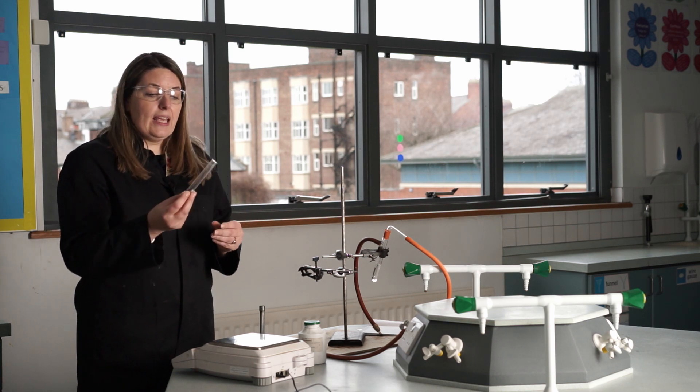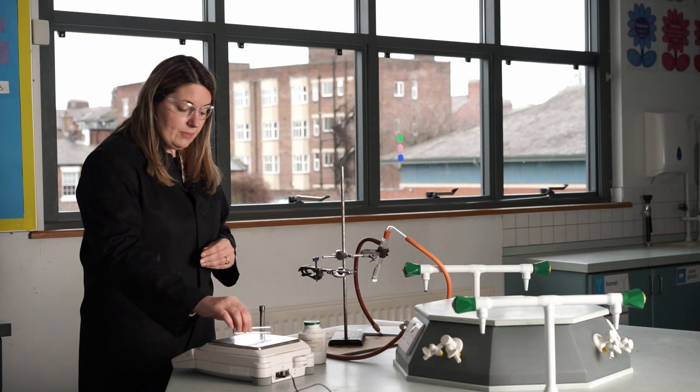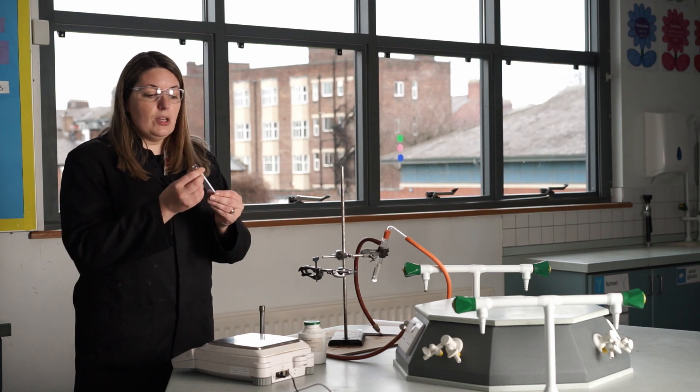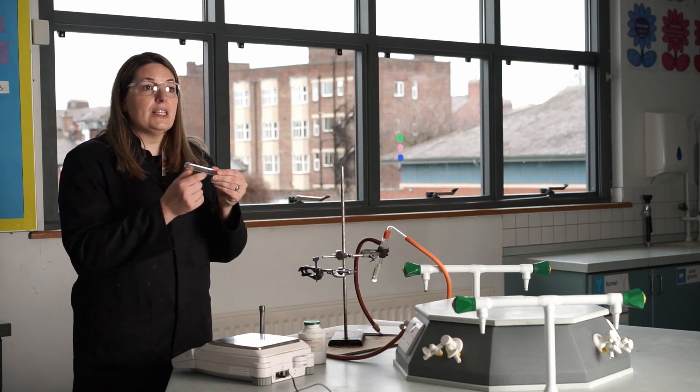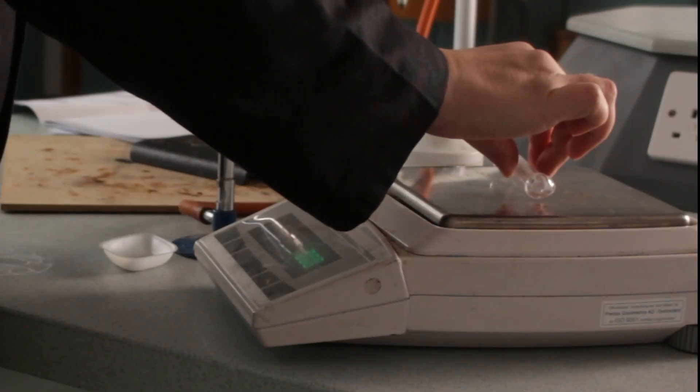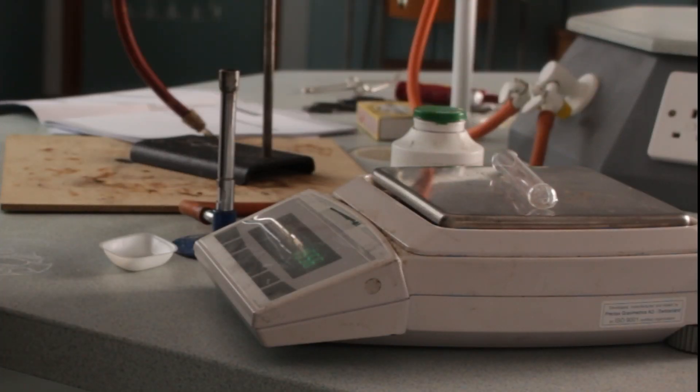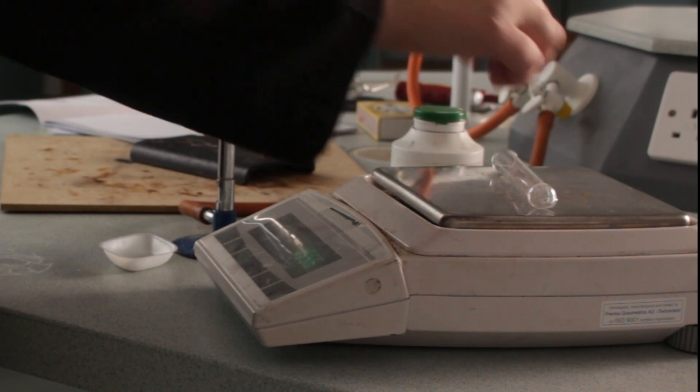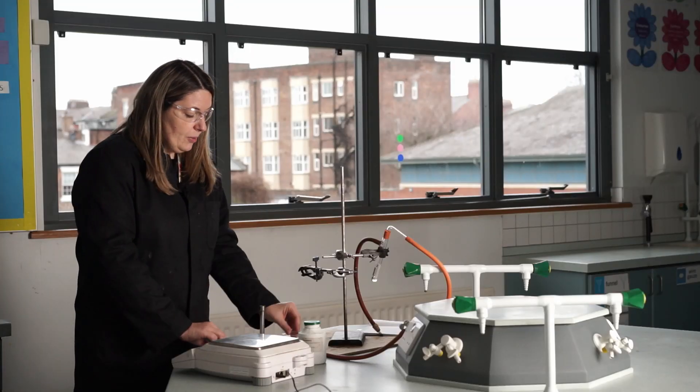We're going to start by taking a tube and weigh our empty tube. So we've got a test tube here which has got a hole in the end which allows gas to escape. That's going to be our tube that we're going to use today. I'm going to weigh that without anything in and that's 15.56 grams.